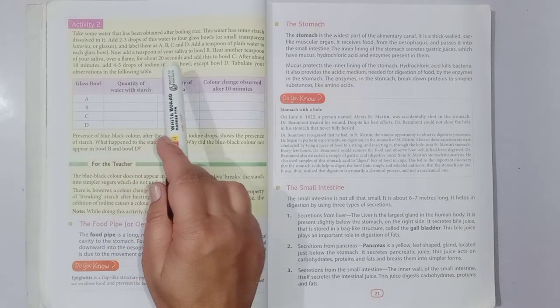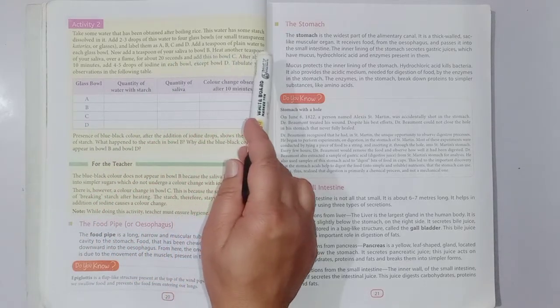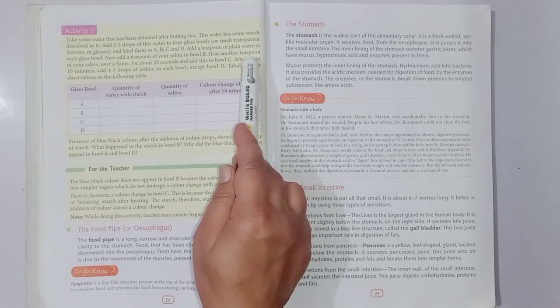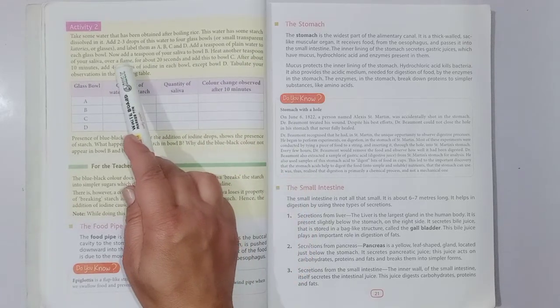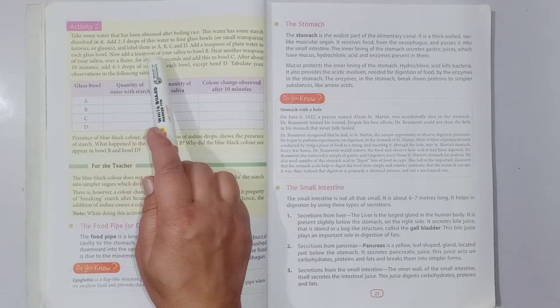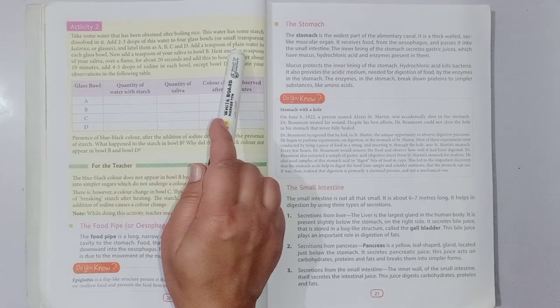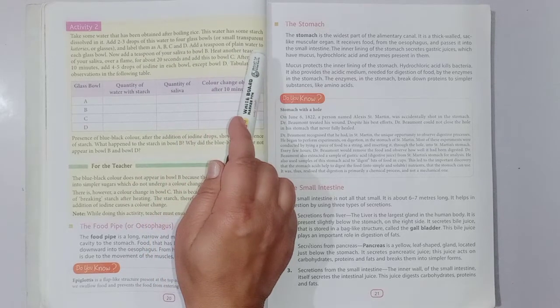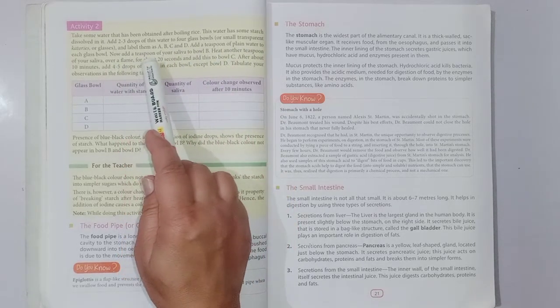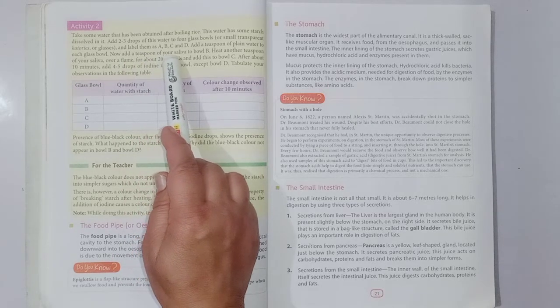Take some water that has been obtained after boiling rice. This water has some starch dissolved in it. Add 2-3 drops of this water to 4 glass bowls or small transparent katoris or glasses and label them as A, B, C and D.